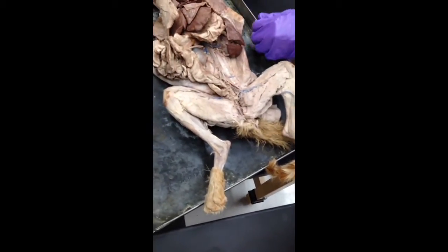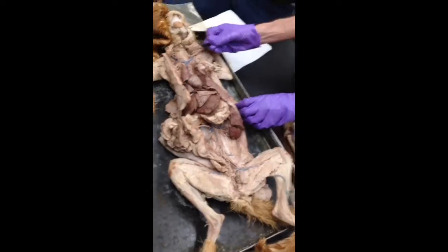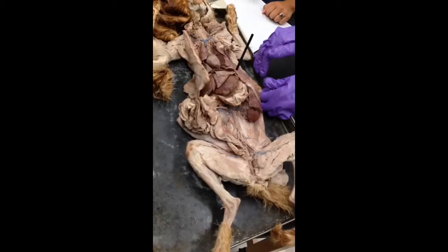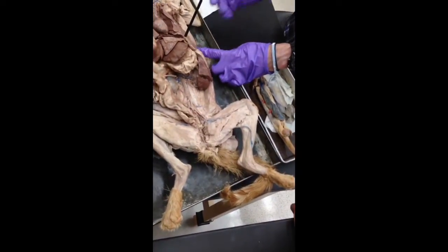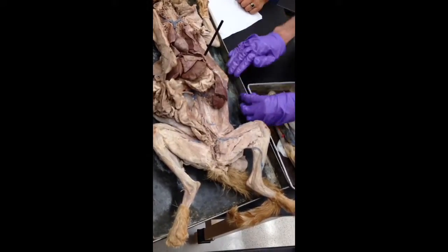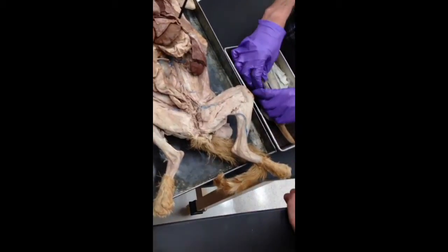So that's a lot of things. You don't really have to know the arteries from veins separately, except for these few certain cases, like down here and up here in the cat. Especially in the cat, where things are nice and big and clear, it's much easier to ask fair questions on things that are big and nice and clear. In the shark, I kind of gave you a brief run-through. And again, I'm writing these questions, so I'll tend to pick things that are pretty clear what they are.